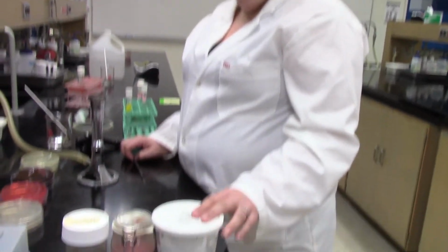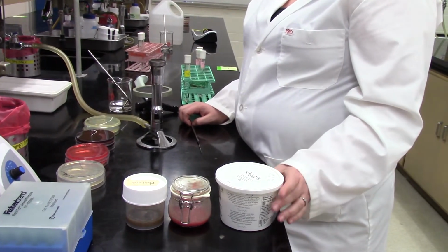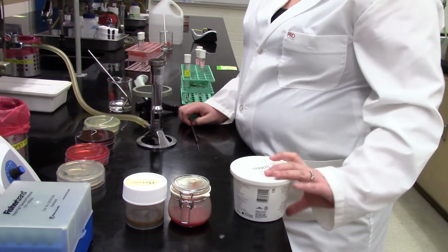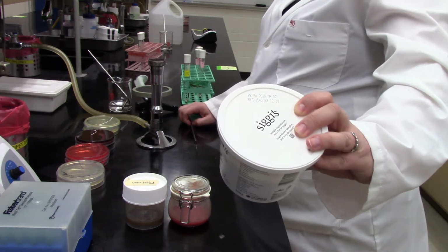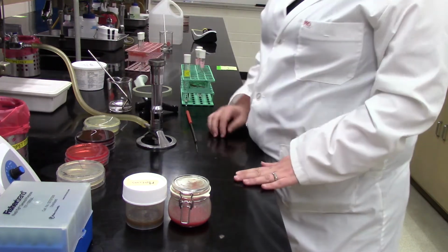So we're not only working today with known bacteria, we are going to do some of that, but we are also going to work with some food samples. Here they are down here. So these ones are going to be a very expired yogurt sample that's expired a year ago. Don't ask us why it's still kicking around. We keep it entirely for microbiological purposes.